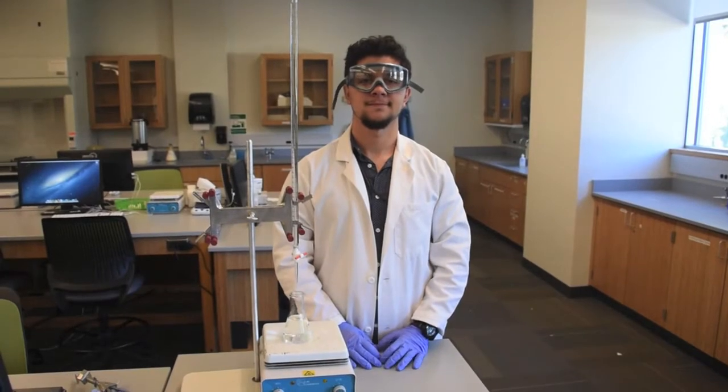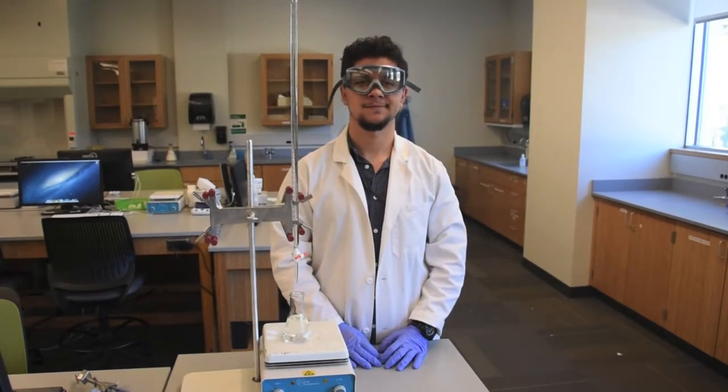Welcome to the Chemistry Lab. Today we will show you how to prepare your burette for a titration. My name is Brian Reese-Wattes and I'm a biochem major from the class of 2018.